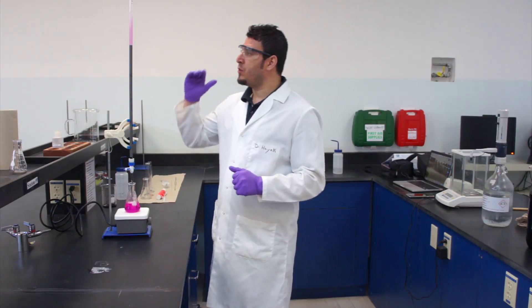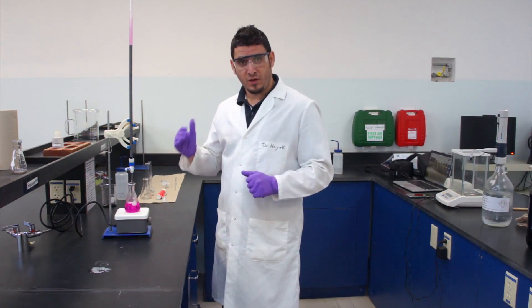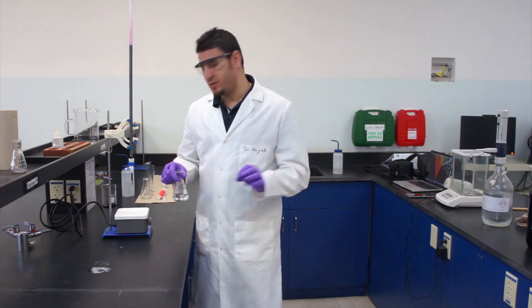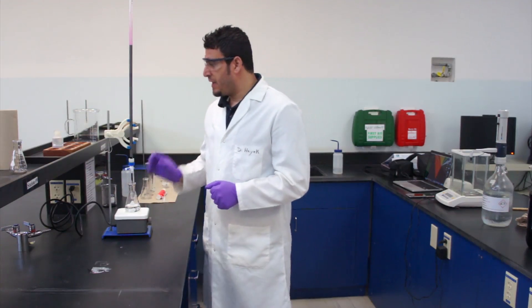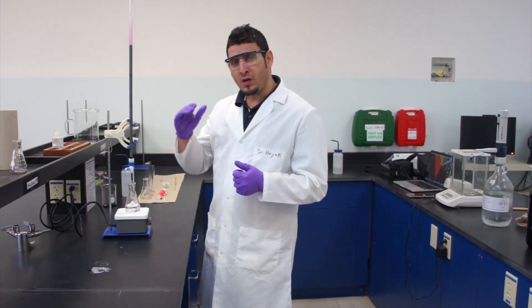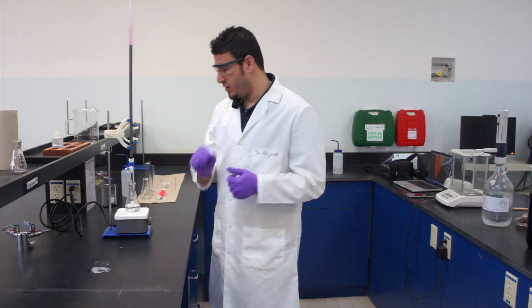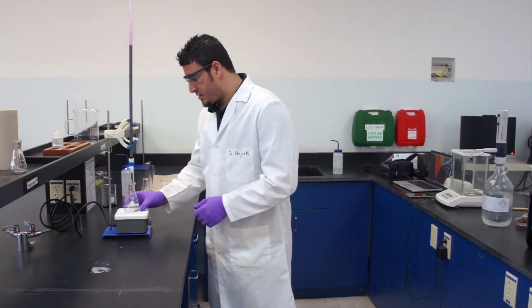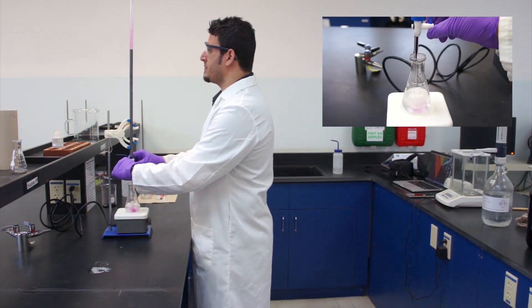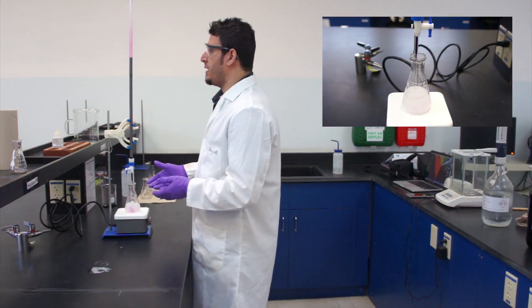Now that I know I will consume around 11 mL, I can start the accurate titration. If I know I'll need roughly 11 mL, I can add up to 9 mL at once, then add the remaining amount drop by drop for an accurate volume. I start the titration and add 9 mL at once — you can see the color is not changing yet.